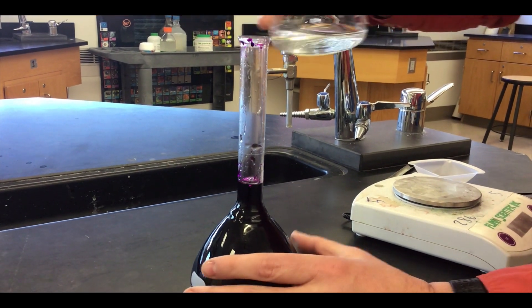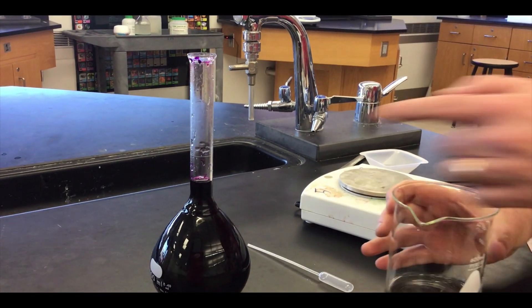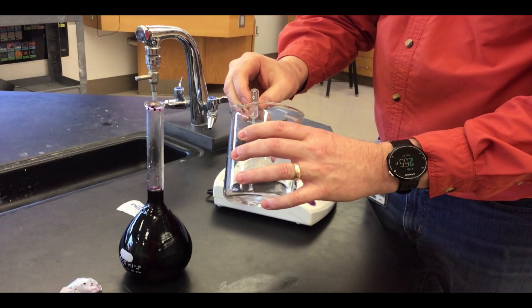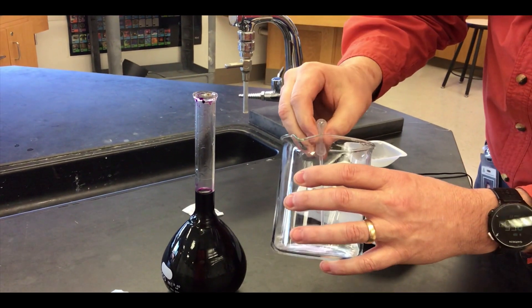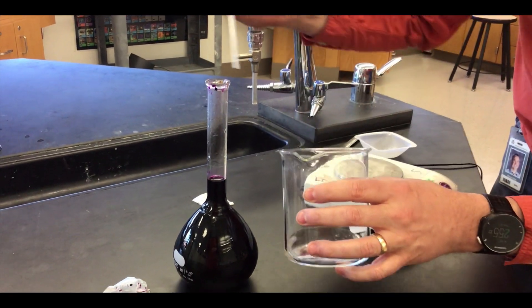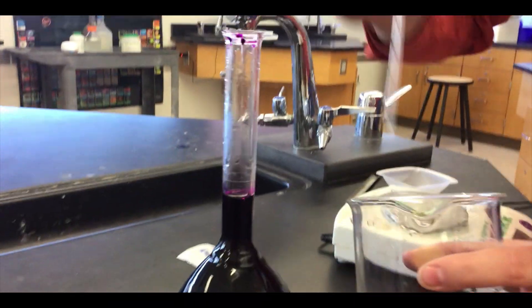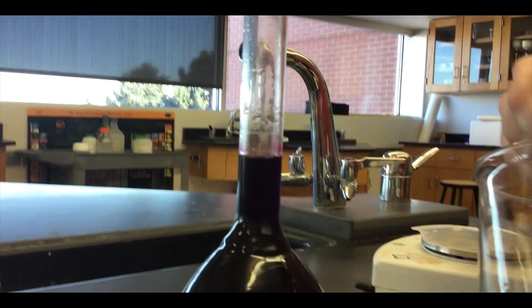So now once I get to that point I have a pipette that I can take some in there and a couple squirts of the pipette to get to the spot that I need to get for the volume.